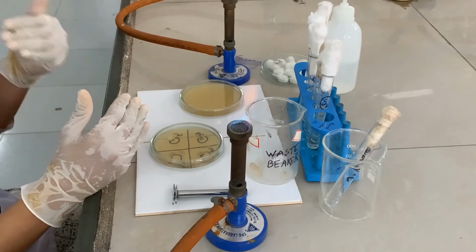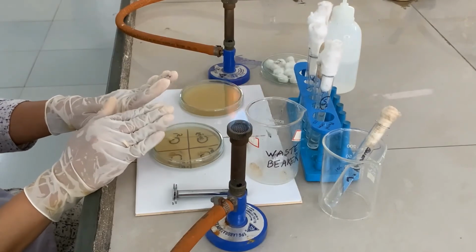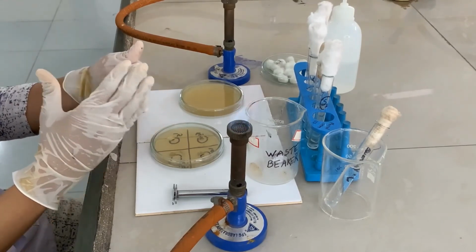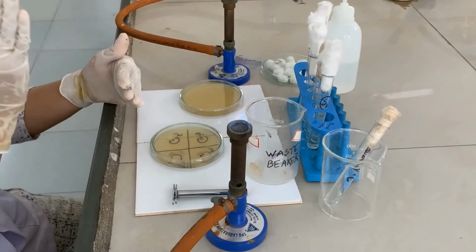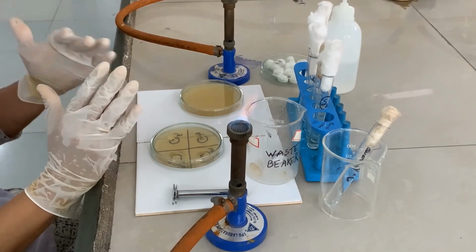After 15 minutes, remove the plate from the refrigerator and place it in the incubator for 24 hours at 37 degrees Celsius. After 24 hours, observe the plate for the zone of inhibition, measure the 3 diameters, take the average and find out the corresponding zone of inhibition for S1, S2, S3, S4, S5 and unknown solution.